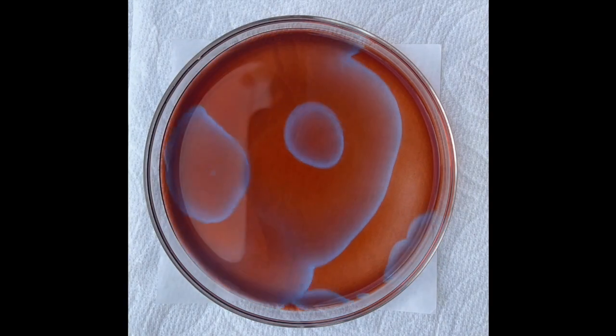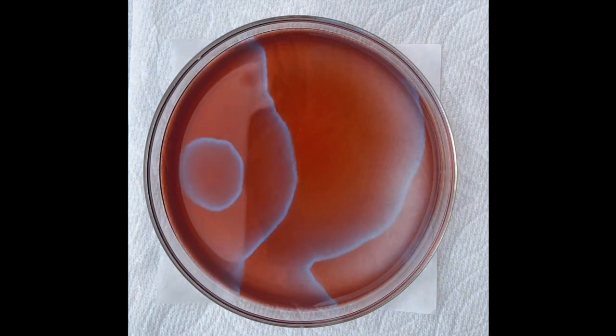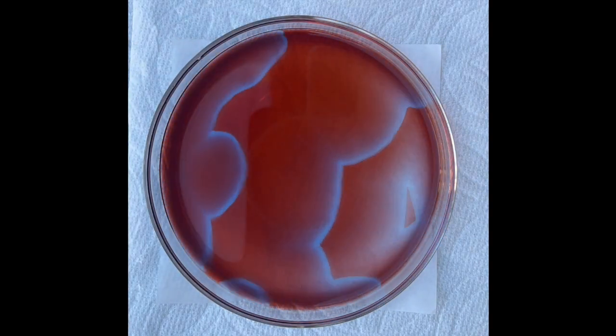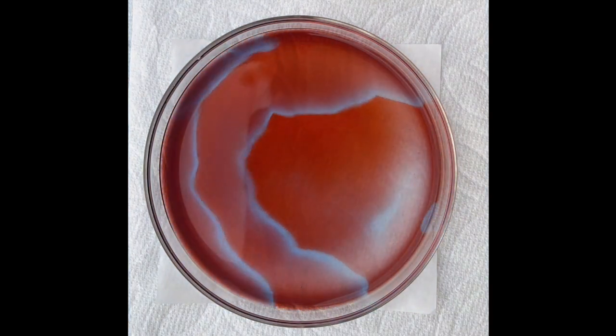In another run, after adding a few drops of cerium-4, the distance between the waves appear to be much farther away, resembling the waves in the ocean.